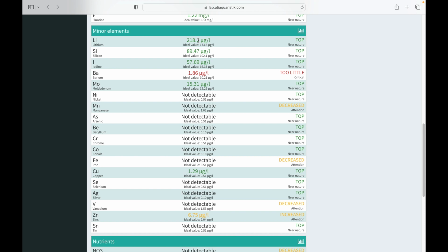So which is it? Is it too low? Is it too high? Or is it okay? I mean, that's a problem. That is a problem. Let's look at the zinc.